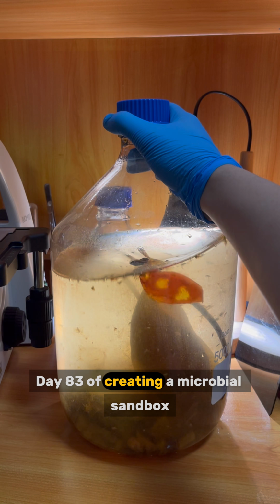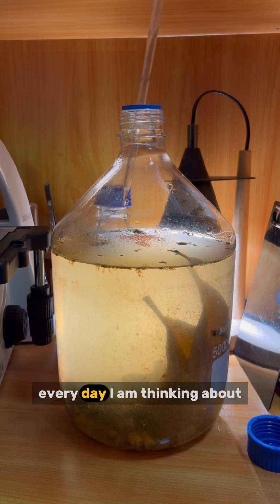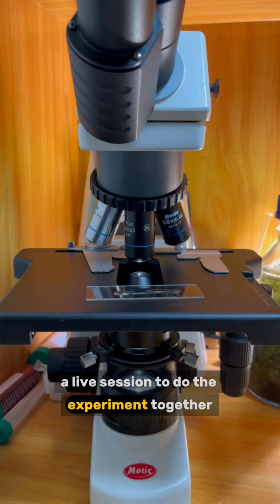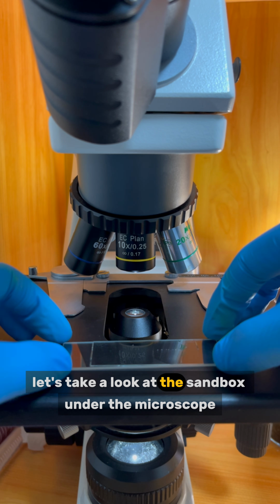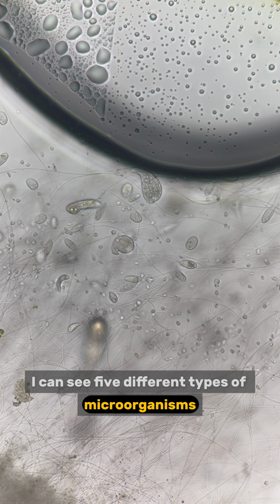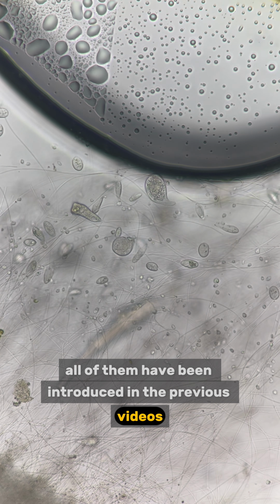Day 83 of creating a microbial sandbox by adding random stuff and observing it under the microscope every day. I am thinking about whether we should find a day to arrange a live session to do the experiment together. Let's take a look at the sandbox under the microscope. In just this view, I can see 5 different types of microorganisms. Can you count them? All of them have been introduced in the previous videos.